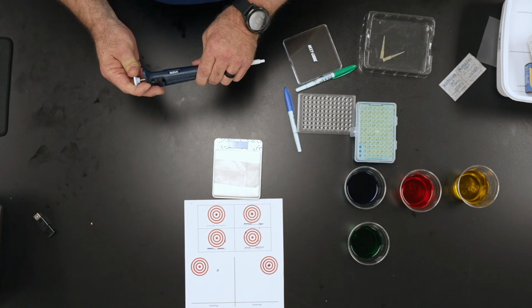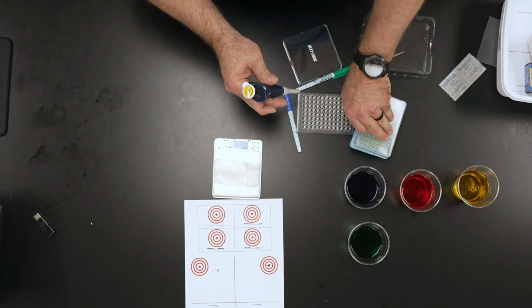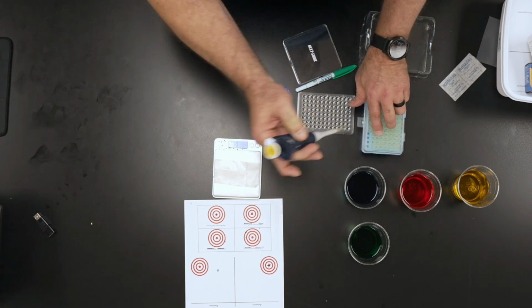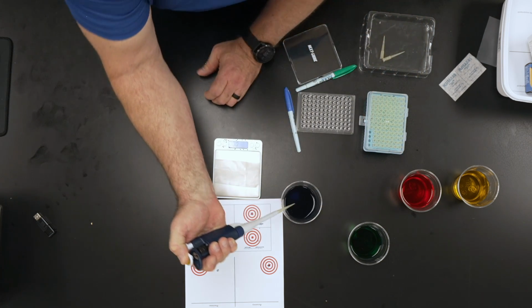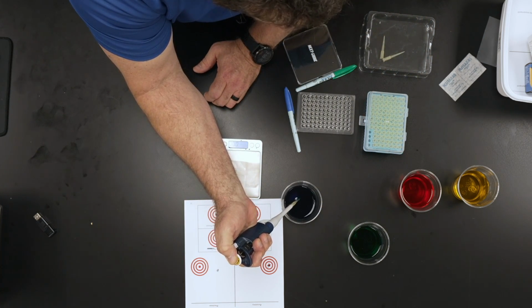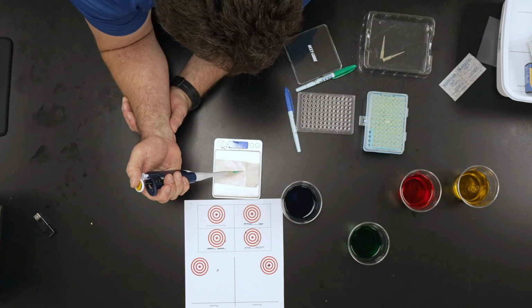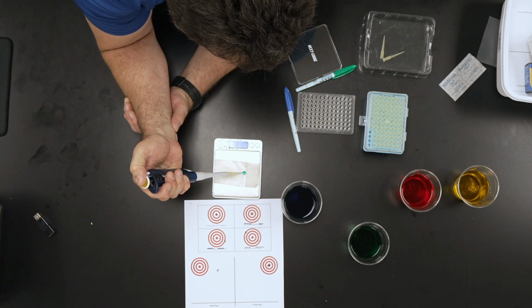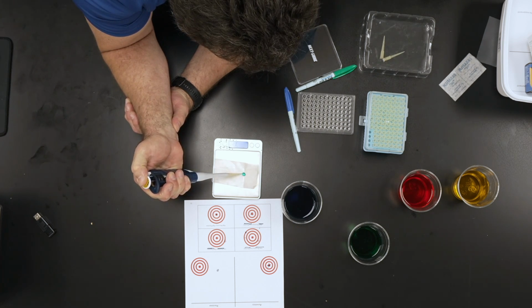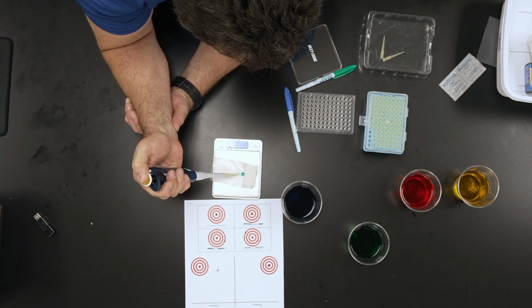I've got this set at 120. I'll just keep it at that. I'm going to go ahead and go to the soft stop on this, get my liquid pulled into it slowly, pull that liquid up, and now I'm going to slowly put it into a little drop here, and it's going to measure once I'm finished with all this. I want those 2 drops to be together. There we go.